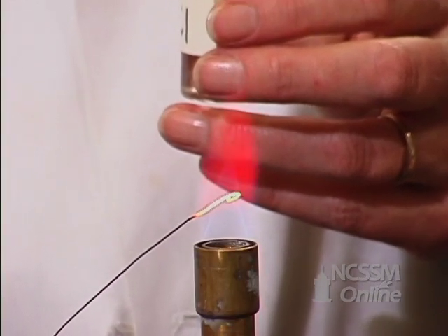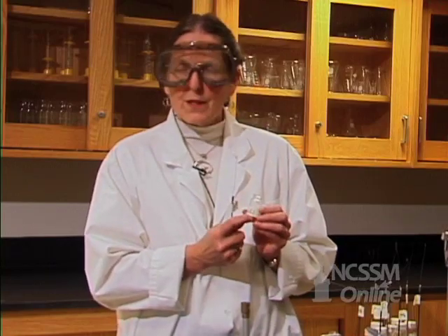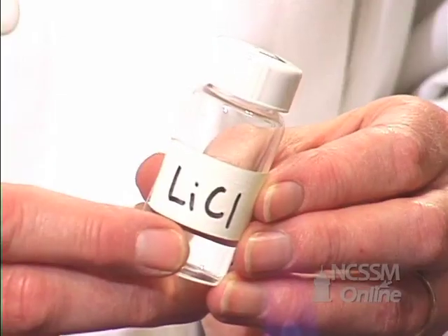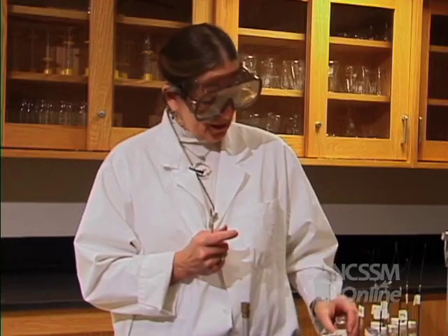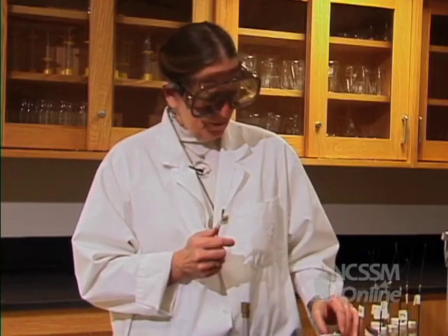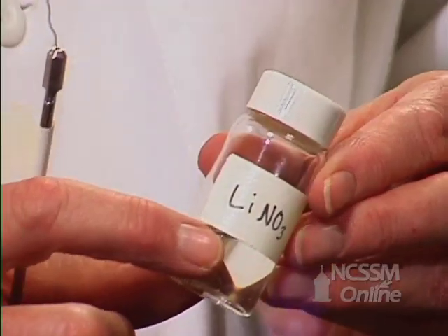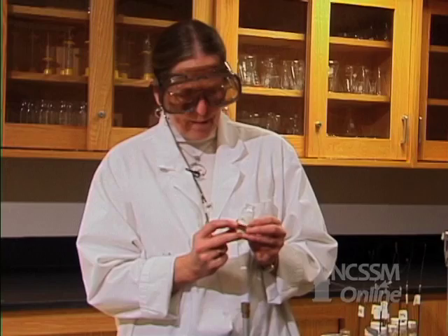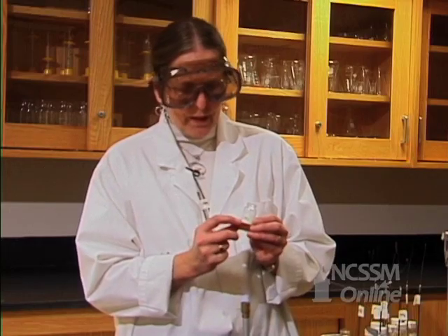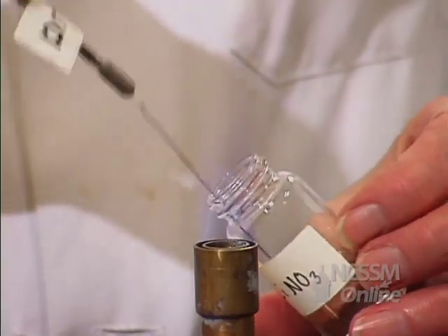Is that color due to the lithium or is it due to the chlorine ion? We can make that decision by trying lithium nitrate. What do you think will happen if it's due to the lithium? So let's try it and see.